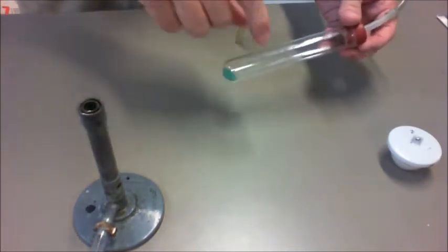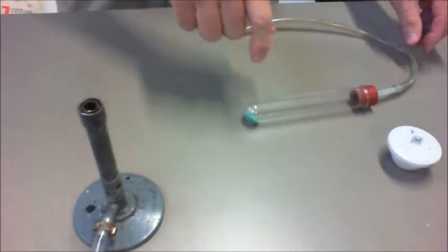And as you can see there, it's a green color. We're going to use the Bunsen burner to do that because it involves the process of heat.